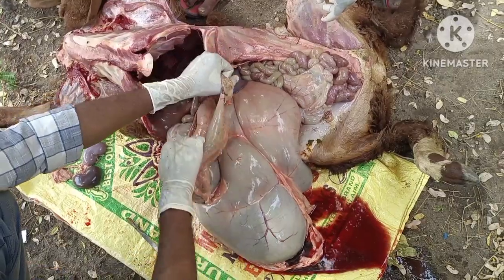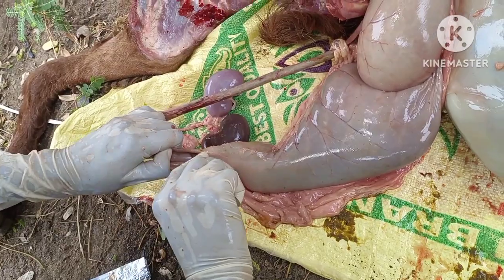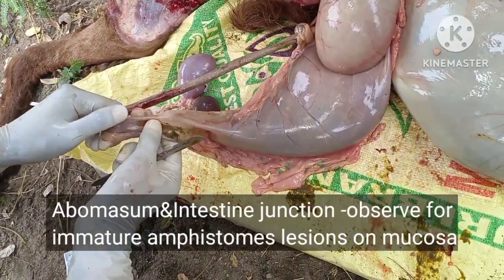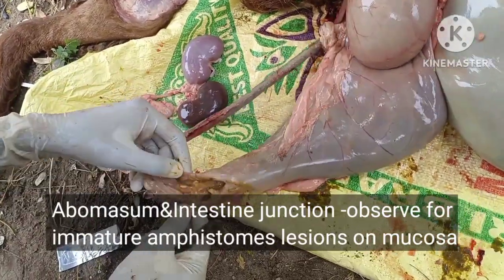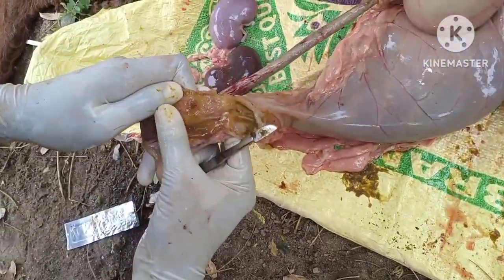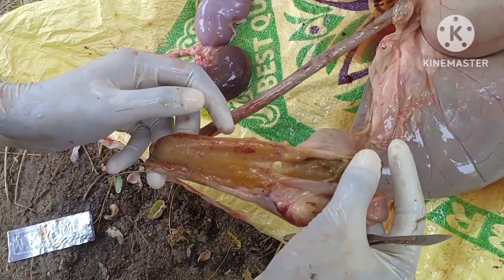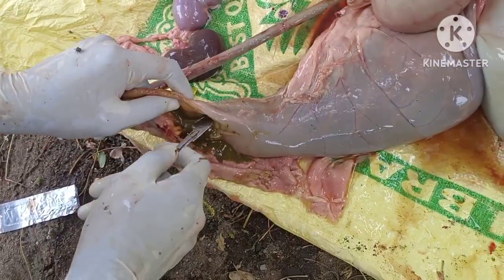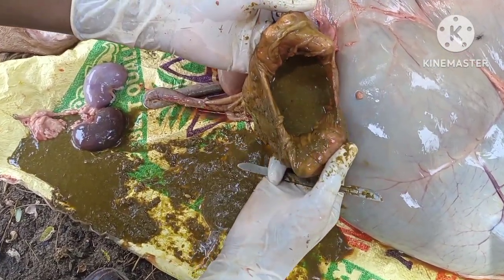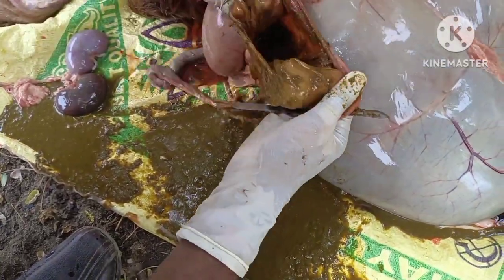Locate the four chambers of the stomach and identify the abomasal and intestinal junction, and cut open and observe the mucosa of this junction so that we can see the immature amphistomes, their larvae, their impressions on the mucosa. Then go into the abomasum by opening the mucosa, and the abomasal folds will look like this, and just spill out the contents of the abomasum.